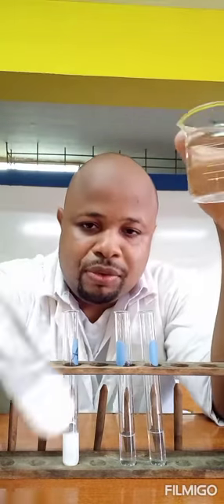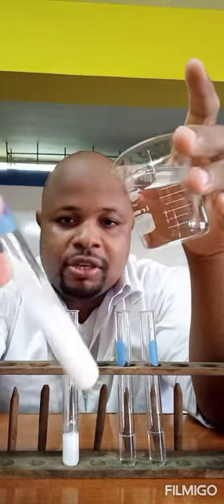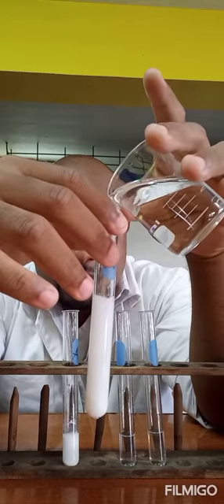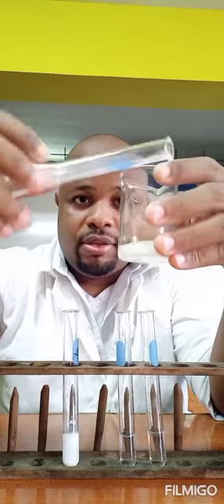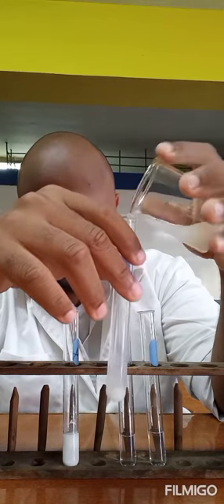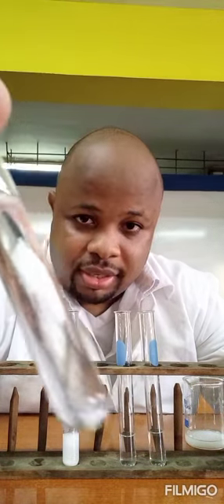So let's add the sodium hydroxide in excess now. We have the precipitate — let's add it in excess and see if it starts to dissolve. The solution is a little concentrated so it will take a lot. As you can see, it will have started to dissolve.